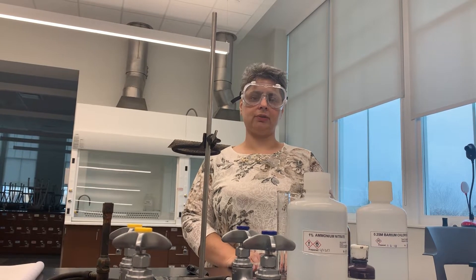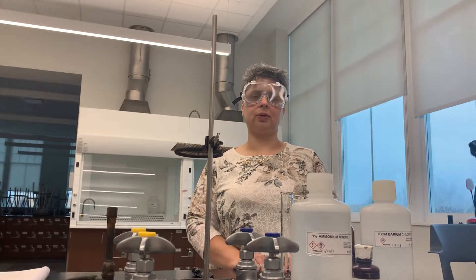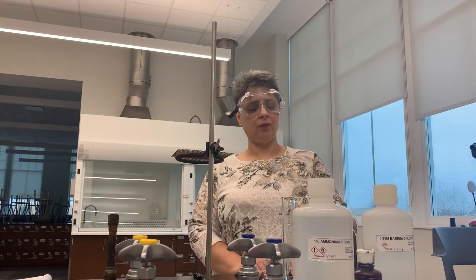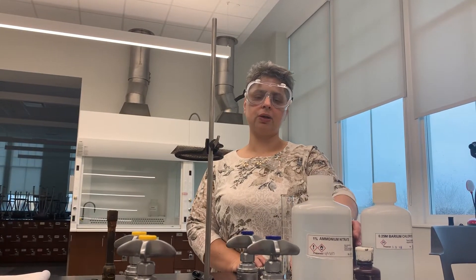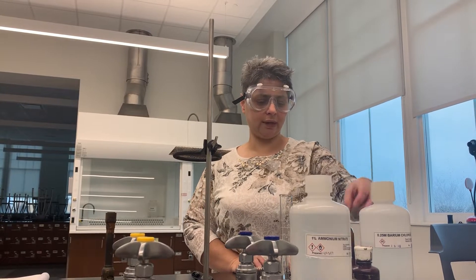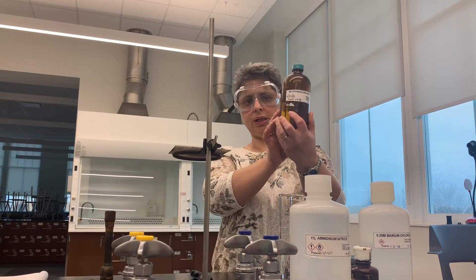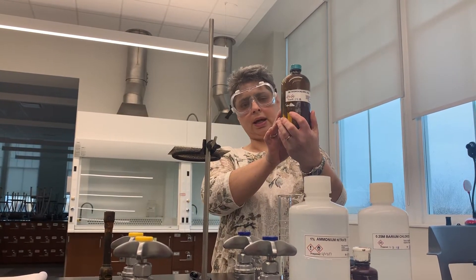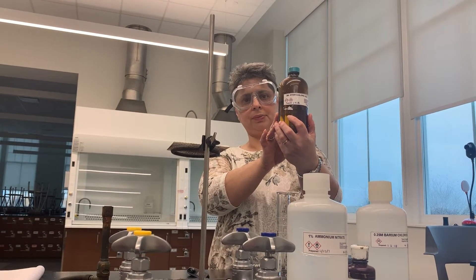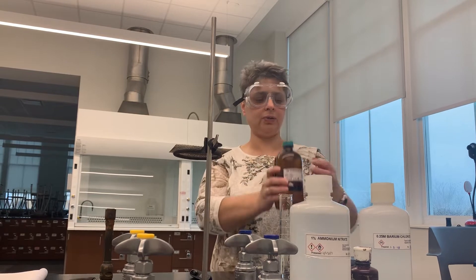Hello again everyone, and we're now ready to proceed with our first part of the gravimetric analysis procedure. First I'd like to tell you about the chemicals we will be using today. What we have here is 3 molar hydrochloric acid, HCl. We're going to use this substance to help us dissolve our coordination compound.